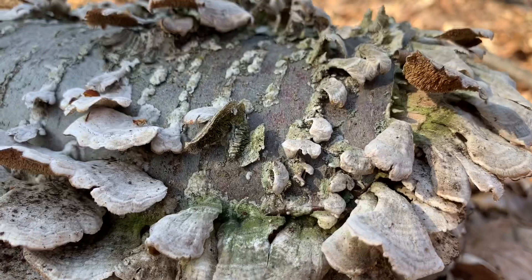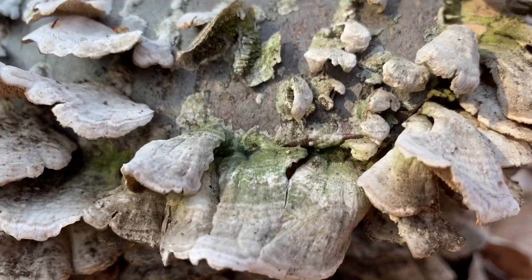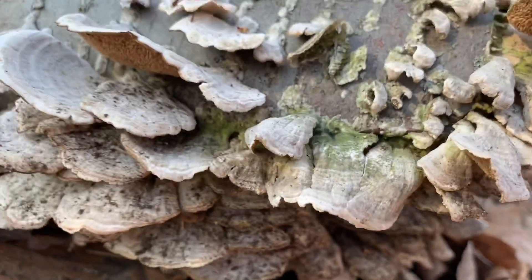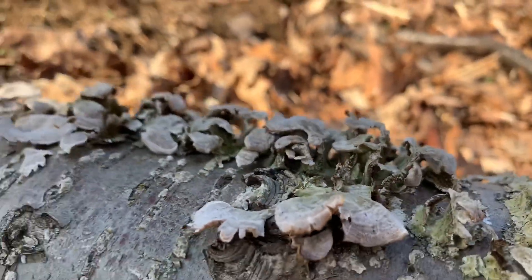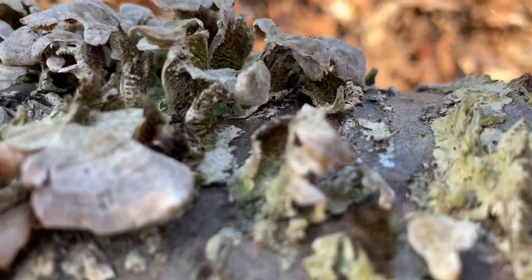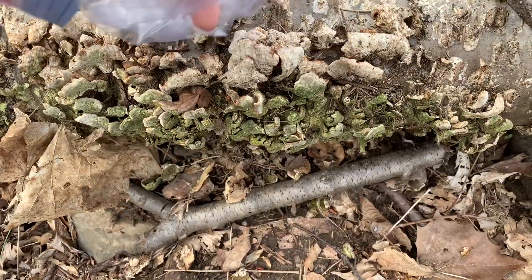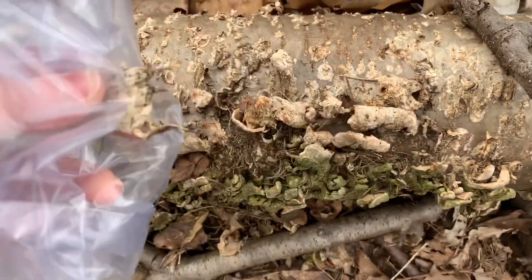The algae and the fungi — so that's algae there, that green — and when it lives with the fungi in a symbiotic relationship, we call it lichen. I should have brought gloves with me.